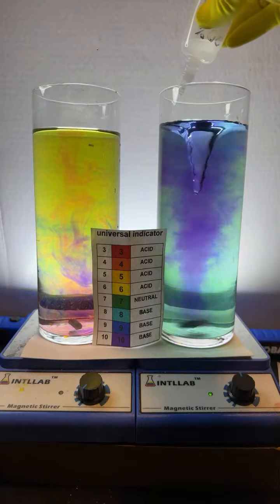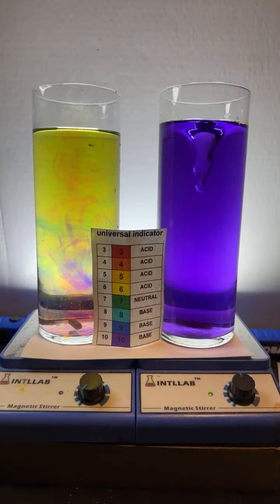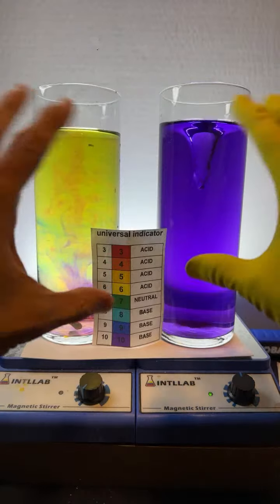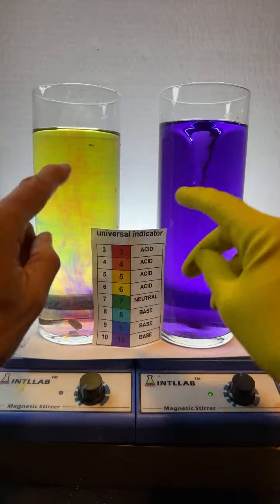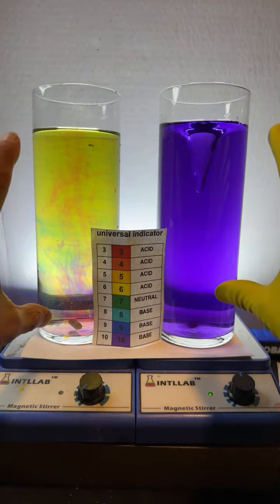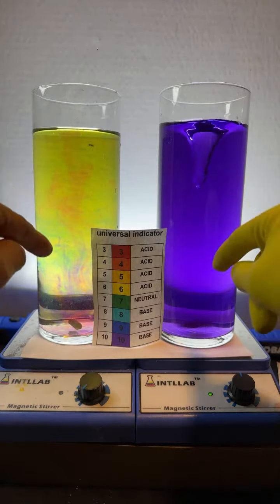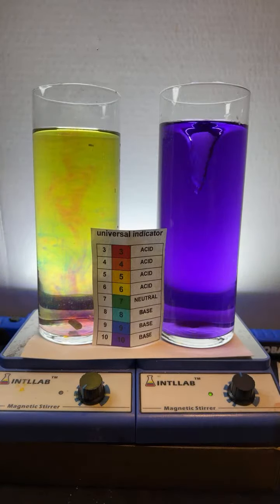I need to get some dry ice for this experiment at some point. So, to answer your question, Andre, after the live is over, what I do is I first acidify them, because I've learned as long as the solutions are pH 3, mold doesn't grow in them. And I just save them and I reuse them. I've been using these over and over and over again. If I leave it at like pH 8 or 9, I've noticed that mold tends to grow in the solutions, and then I've got to rinse them out.